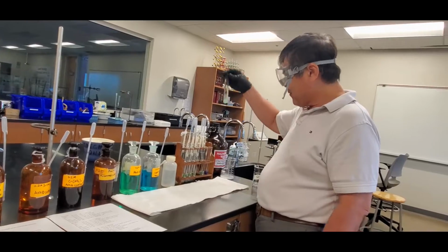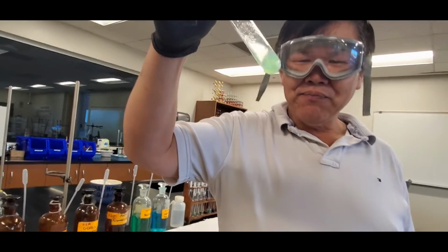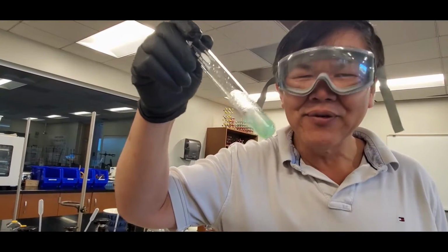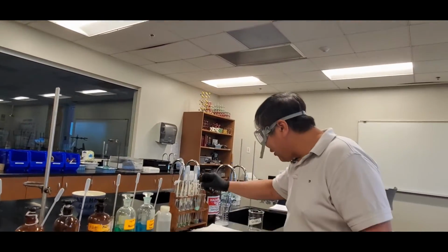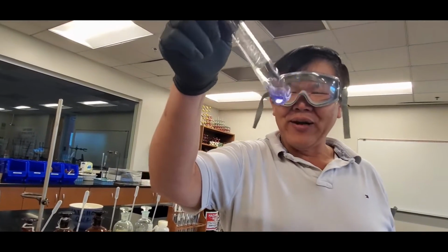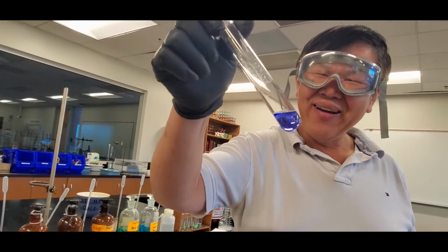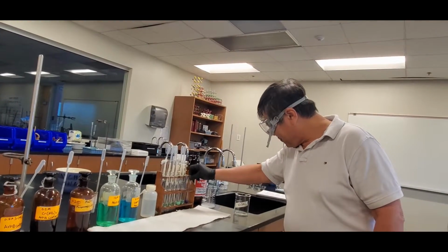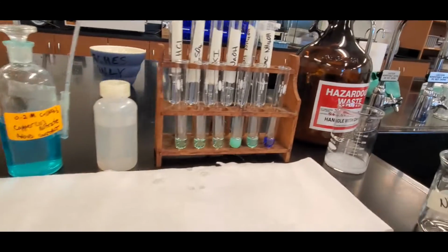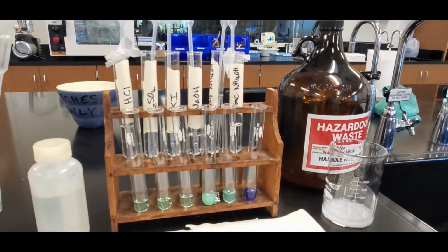Look at this. The one with the sodium hydroxide looks kind of like what the Asian women call jade. They love that. Anyway, that's what that looks like. And the other amazing thing is this one right here with the concentrated ammonium hydroxide. Hey, it went from green to purplish blue. Magic trick, huh? Pretty cool, huh? All right, let's zoom in. What do you think? Colorful magic trick.